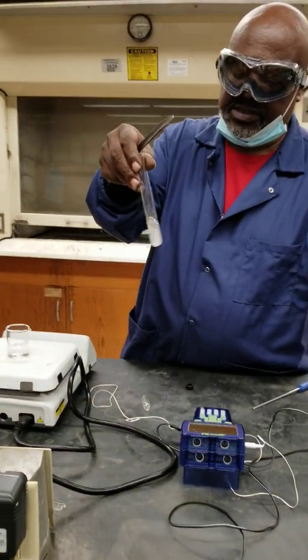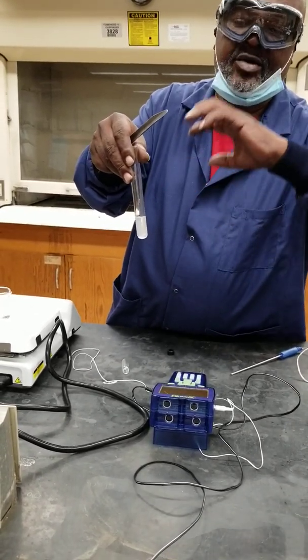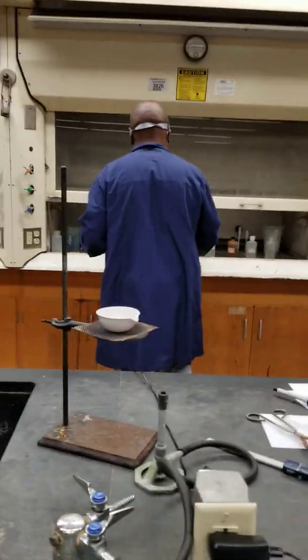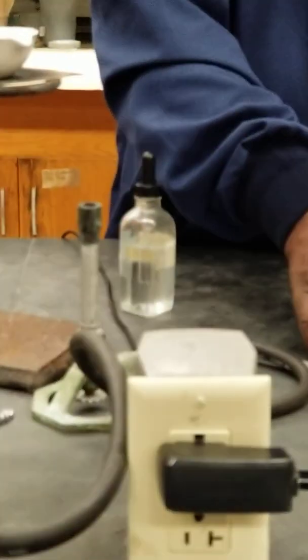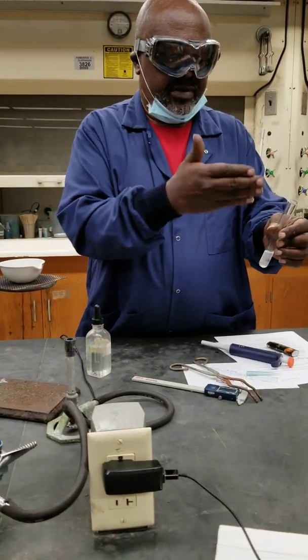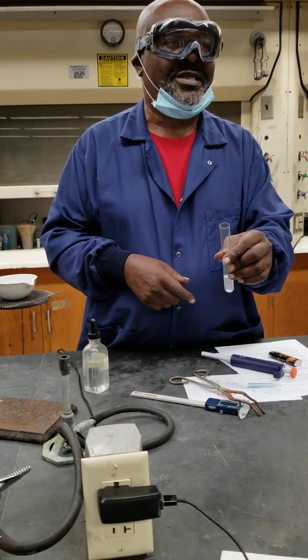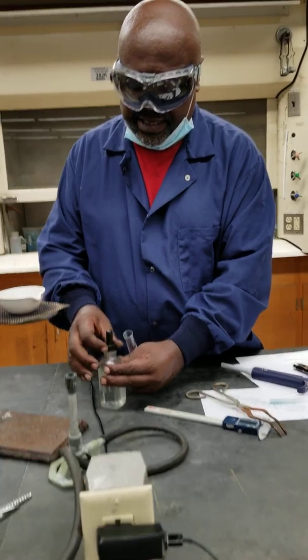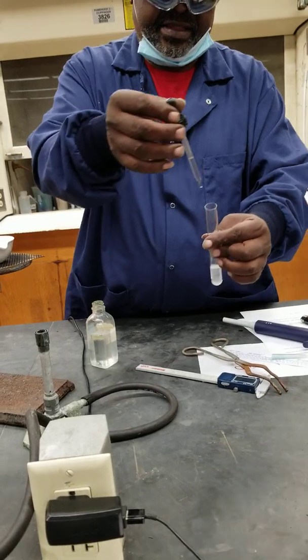So this is the part where it says what happens when you take the residue, dissolve it in water — so it's now aqueous, meaning it's dissolved in water — and then we're asked to see what happens when we add HCl, hydrochloric acid. When you do these things, you always want to think about what's going on. Don't point it at your neighbor either, just in case something unusual happens. HCl here is quite concentrated, quite corrosive, so you've got to be careful.